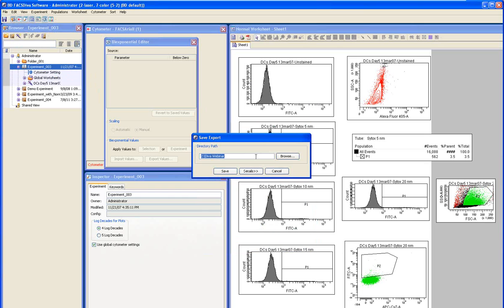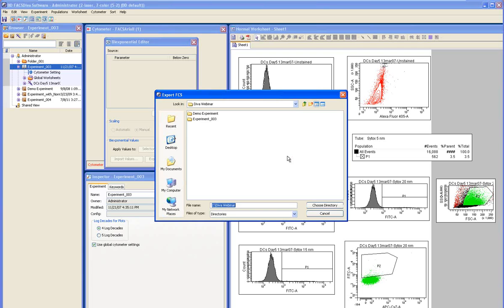This time I'm going to do something slightly different. Instead of putting them in the same folder, I'm going to put them in a subfolder. The reason for that is to show you something else that happens when you're doing the import. I'll just call these my FCS files.